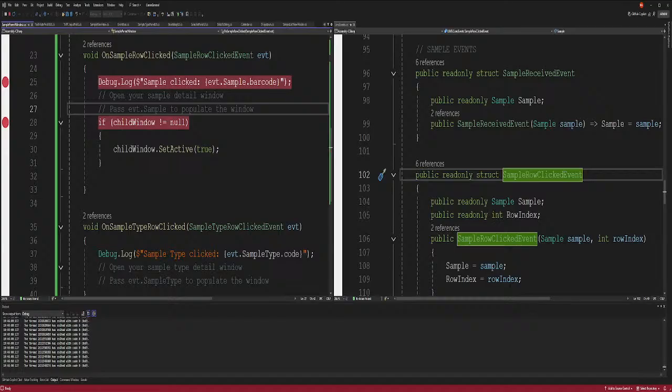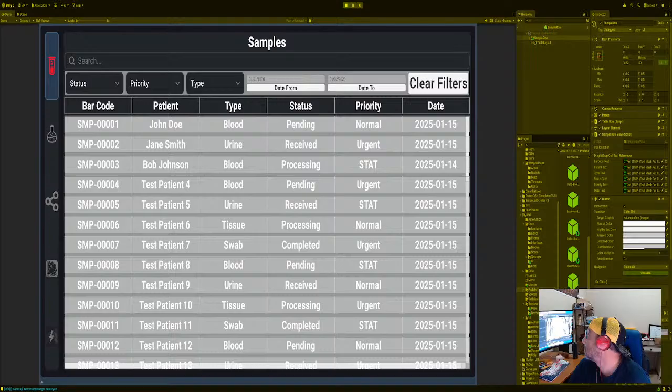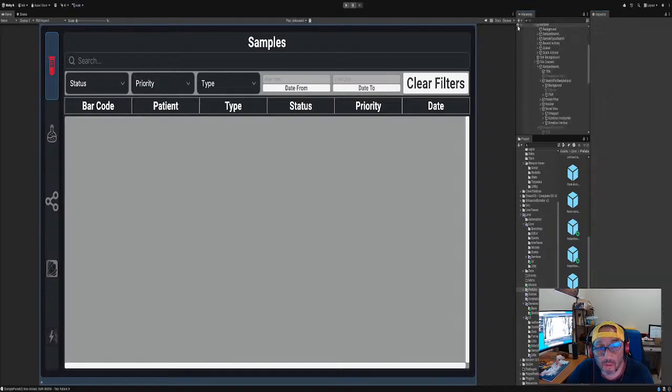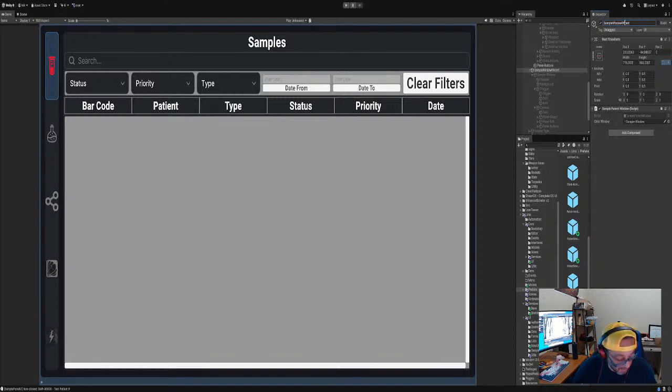They're all blank as you see. Oh, I'm sorry. Make sure that. Yep, there we go. So we're testing this out. As you can see, the buttons are working, in and out. Now we got to make sure that the buttons, we click on here, and then we drag and drop this right here. And then we go here to sample view, and that should just display data. Right? We got that. And then we go back over here to the window, sample parent window. I misspelled that, bad grammar, sorry. A sample window, and we did the sample window, right?